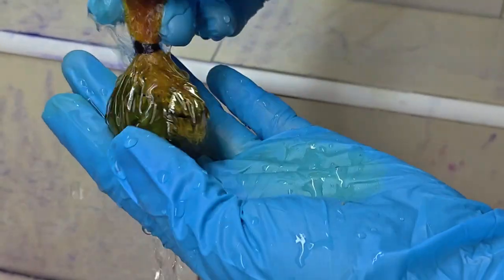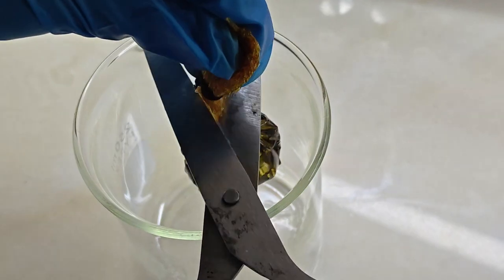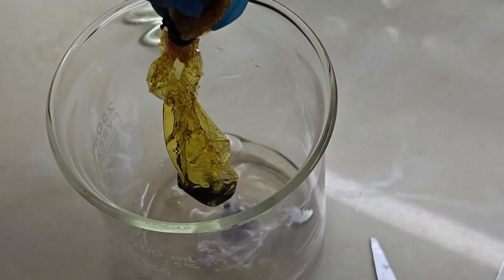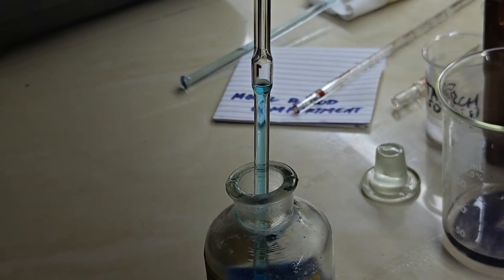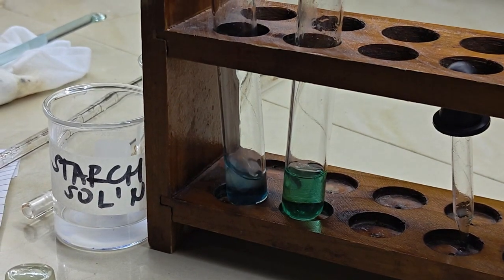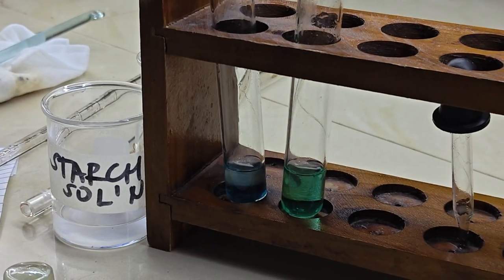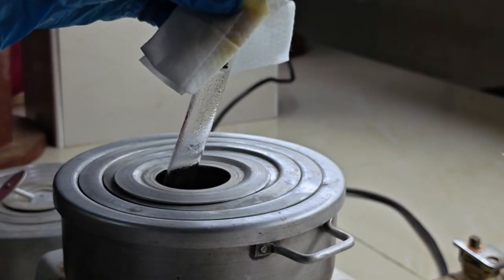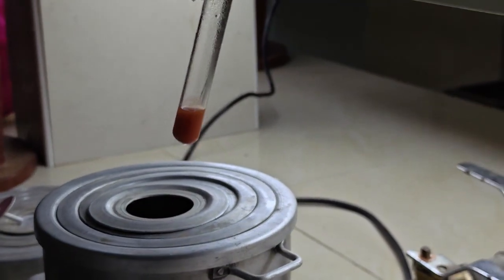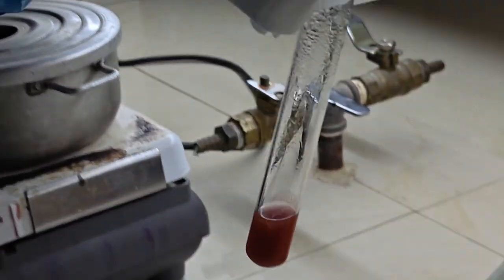After thorough rinsing, the solution inside the bag was removed and poured into a beaker. This was then sampled and mixed with Benedict solution into a test tube, similar to the previous ones. After heating, the solution had turned into a deep color, meaning the solution inside the bag had very high levels of glucose.